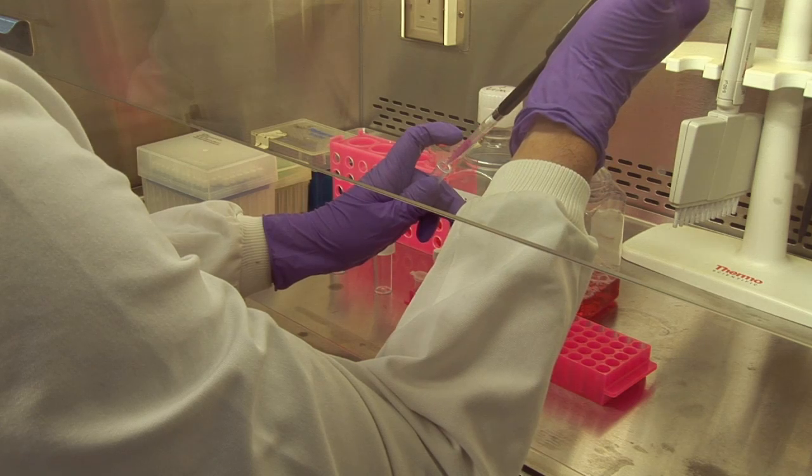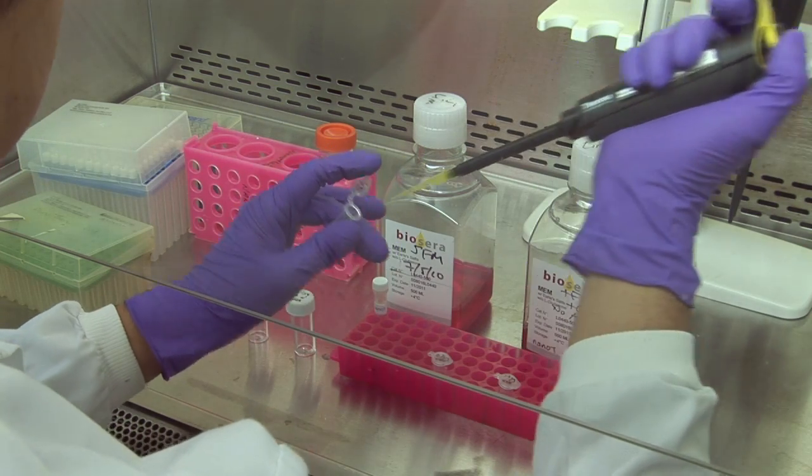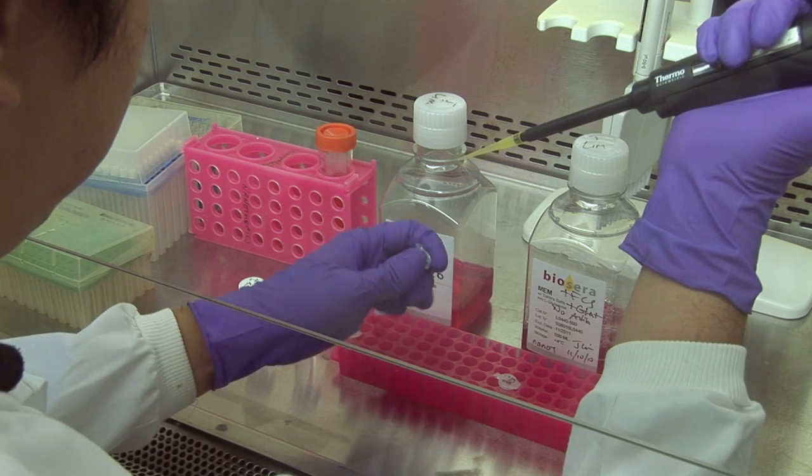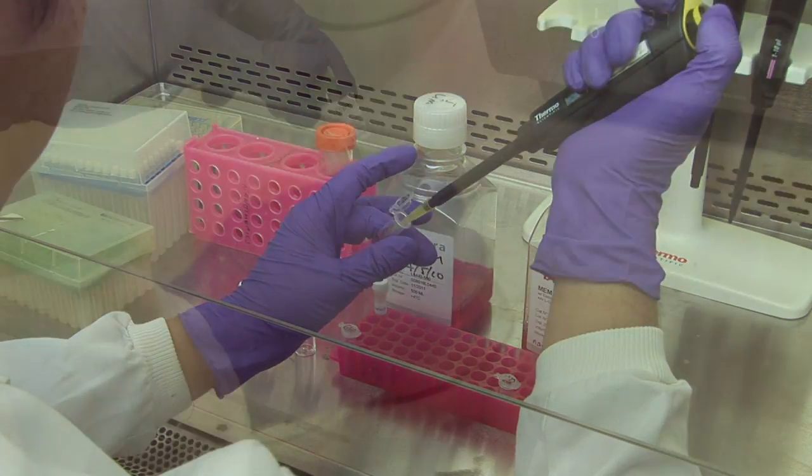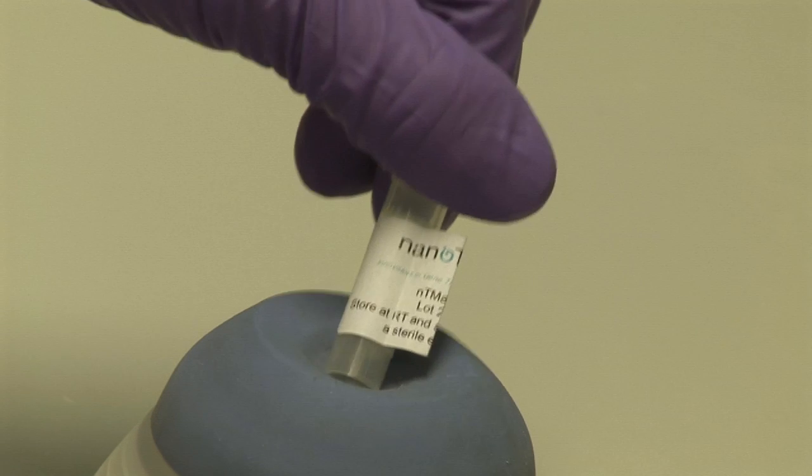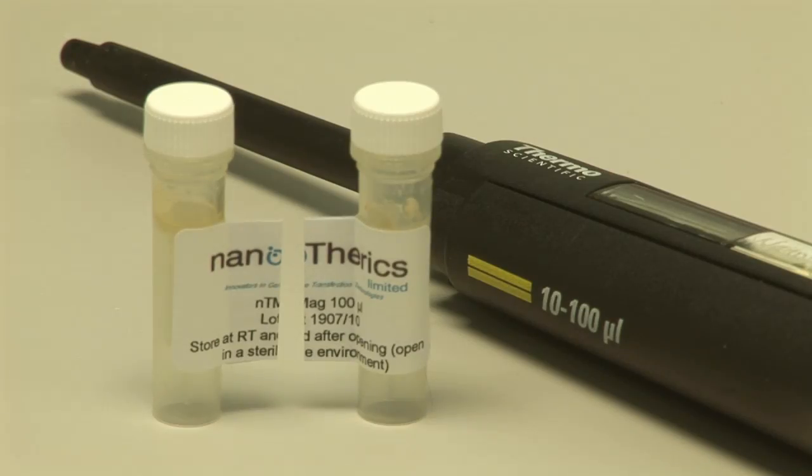Prepare the DNA solution. Resuspend the DNA in a volume of supplement-free medium that is 5% of the total volume of the transfection complex required. Before each use, vortex the stock of the NT-Mag magnetic nanoparticles. NT-Mag is stored at room temperature and has a 1-year shelf life.